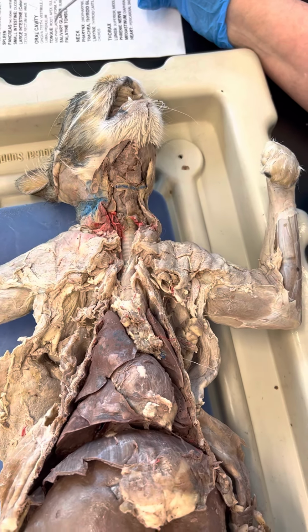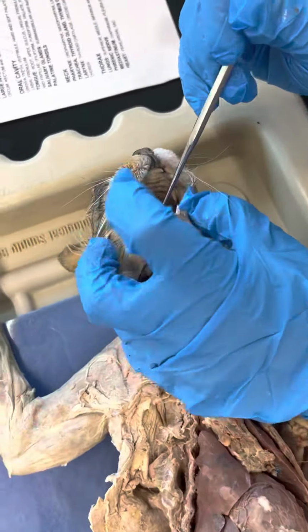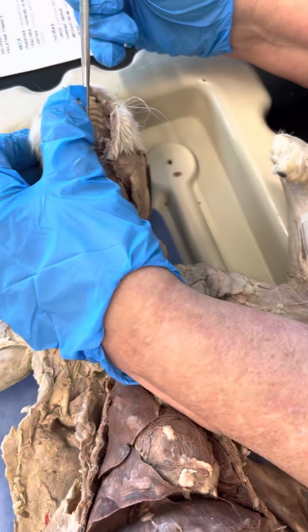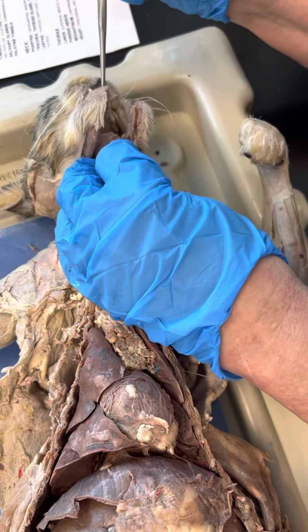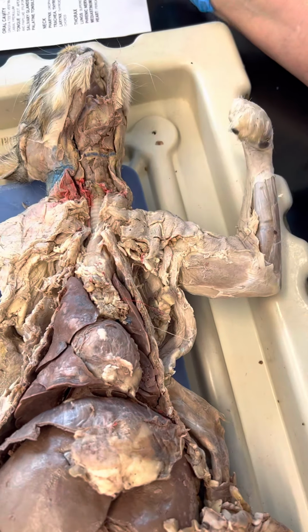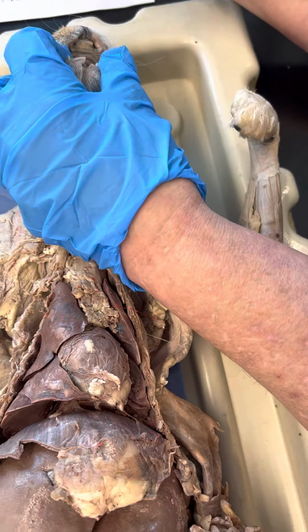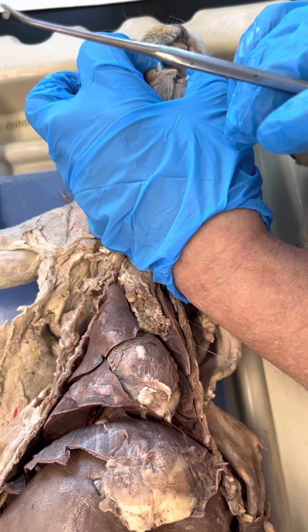The lingual frenulum is the piece that attaches the tongue to the floor of the mouth. It's a little hard to get to, but see it right here? If you stick your tongue up, you can see where it's hooked on the bottom. So that's pretty easy. Now you have your tongue. You have the root. Where's your root? The very back. The apex is the very front.